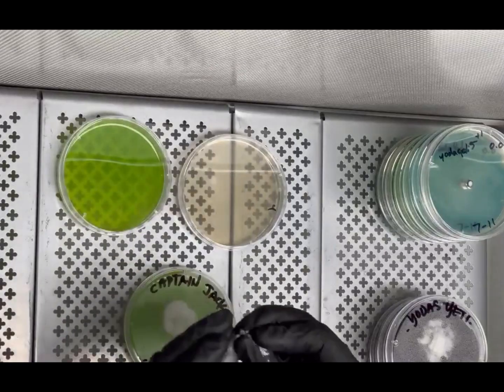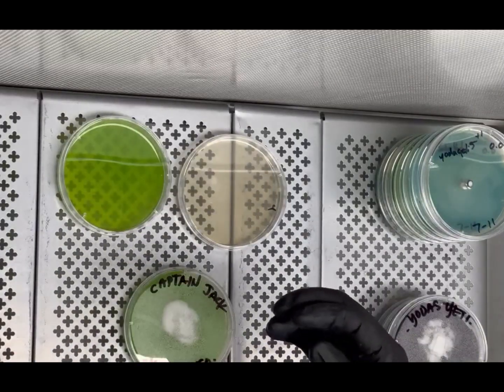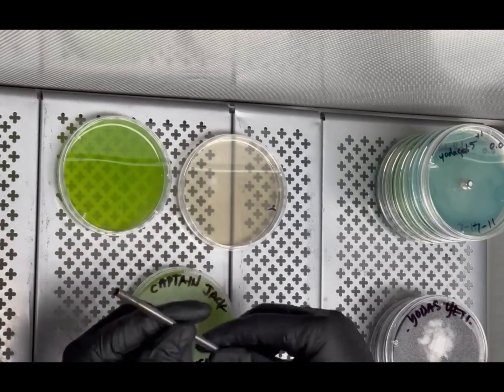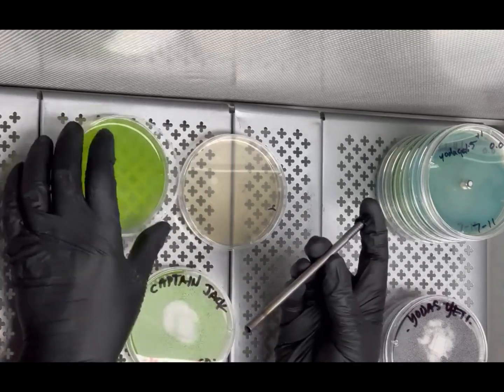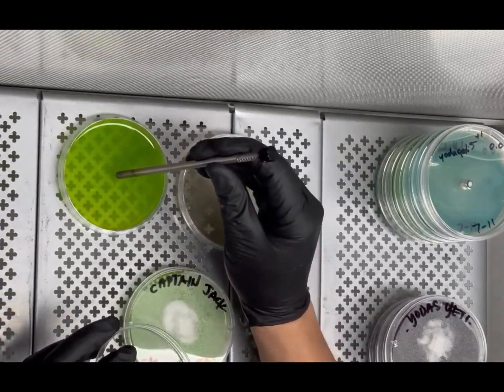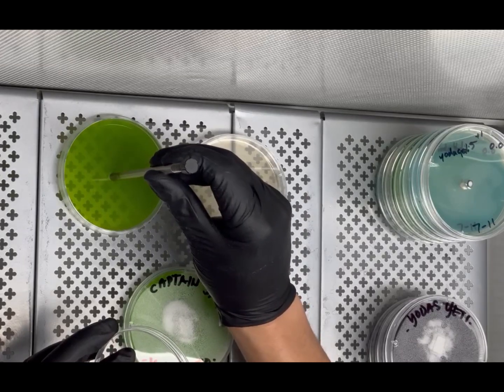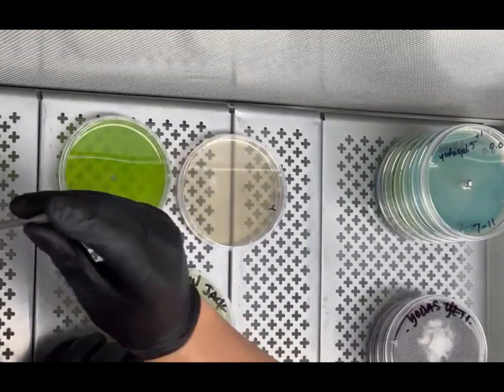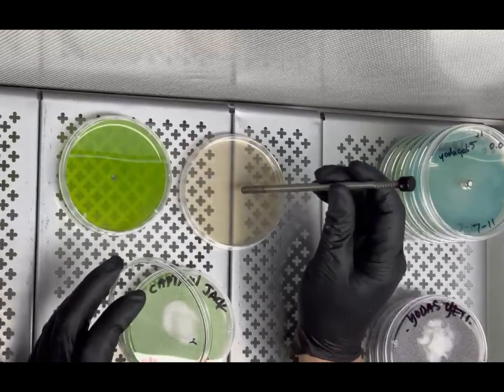It's a pretty simple process on how to use these. You just take your little mechanical punch here and you're not pushing on the spring to begin with. You're just putting it at an angle, going upright, twisting and removing, and then you depress the plunger and eject it.